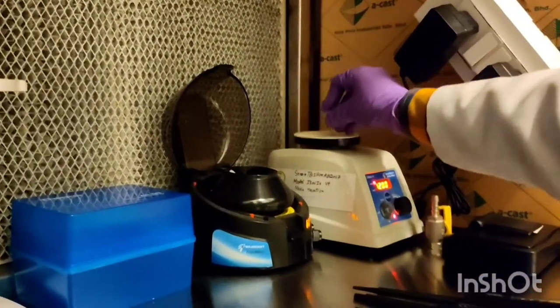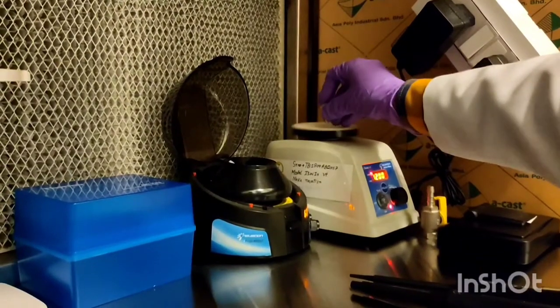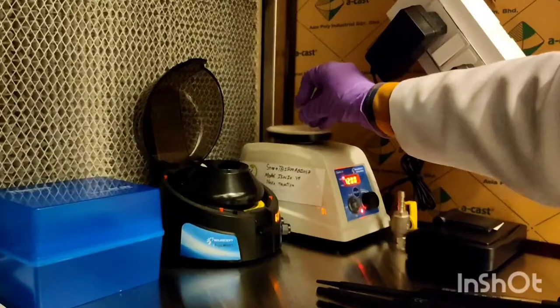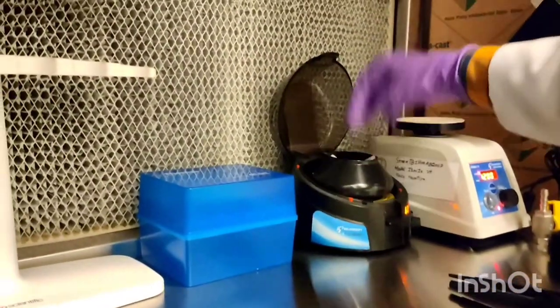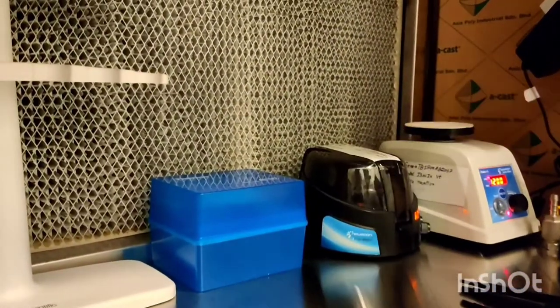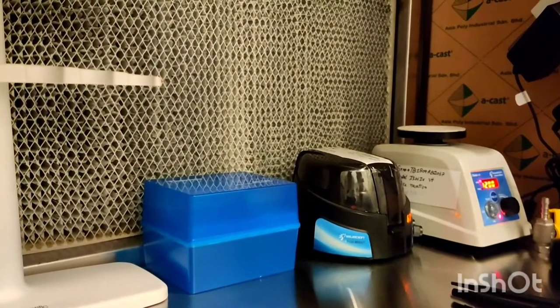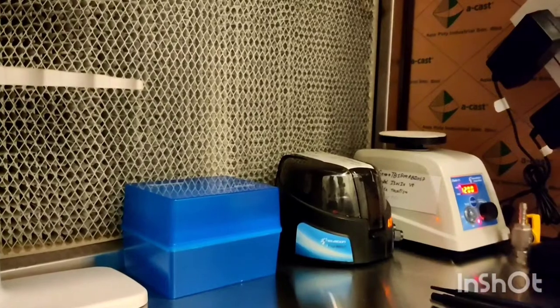Vortexing the prepared mixture for five times. And now centrifuging. We have to centrifuge it for 10 to 15 seconds.